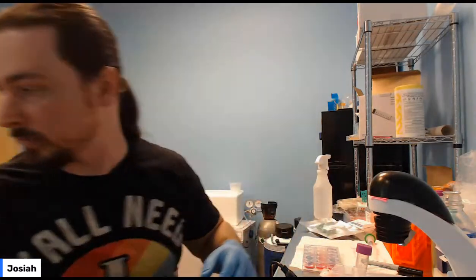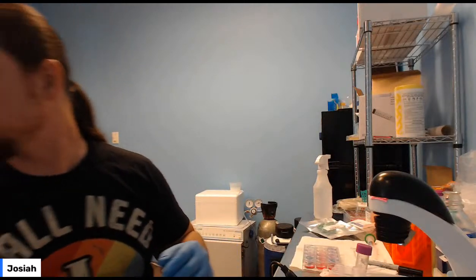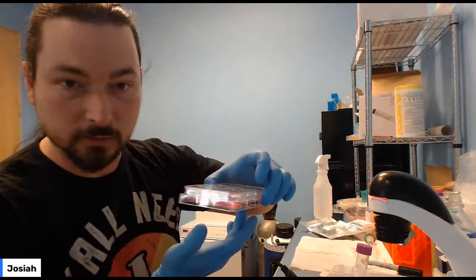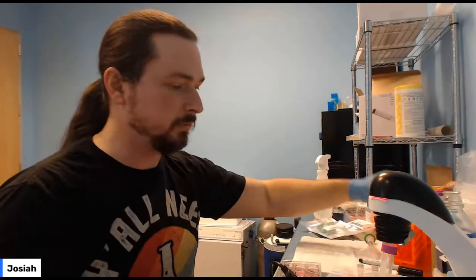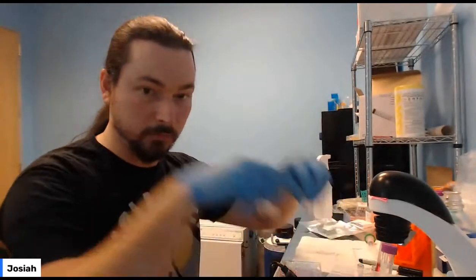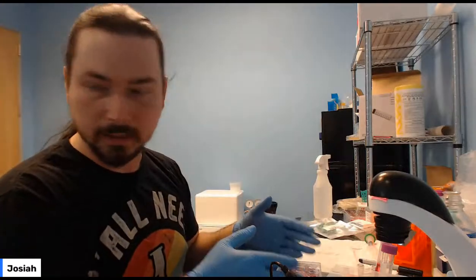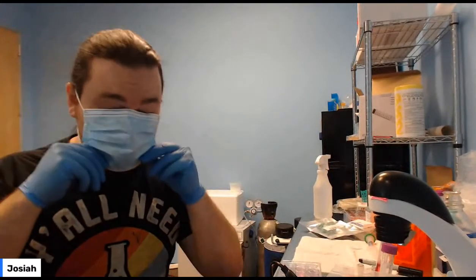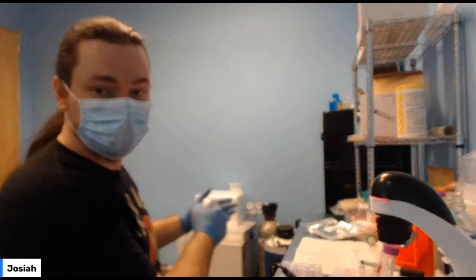Let's see, how are we on our timer? Okay, about 3 minutes. So what we need to do is change the media in the wells that we're going to modify. You don't have to change the media in all of them, but do change the media in the ones that you're going to be adding these 4 to. So you go through, you pick the 4 you like, and you've got extra wells, so pick the healthiest and best ones. That's going to give you the best results.